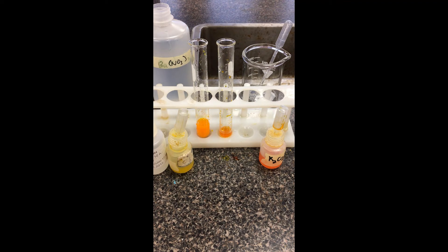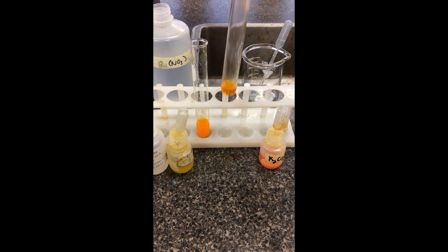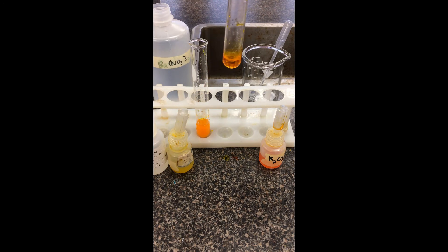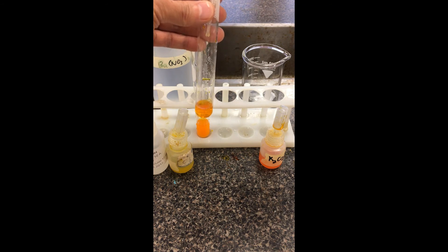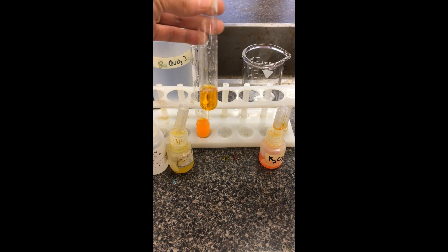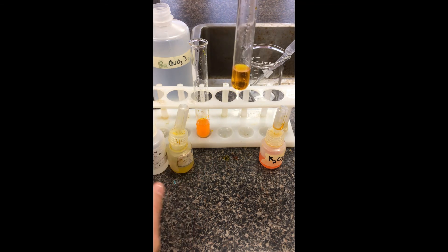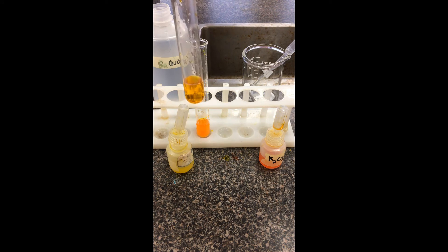We're going to do something very similar with the dichromate, except for the dichromate we're going to be adding the acid first. The dichromate is beginning as an orange color. We're going to drop in two or three drops of acid, then throw in the barium nitrate and see what happens — noting any changes. Then I'm going to add in base until we see other color changes.